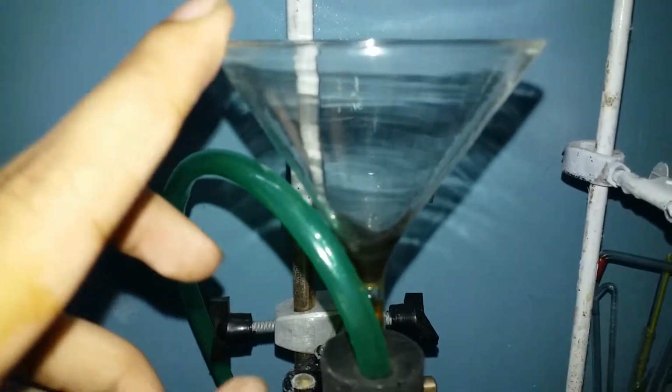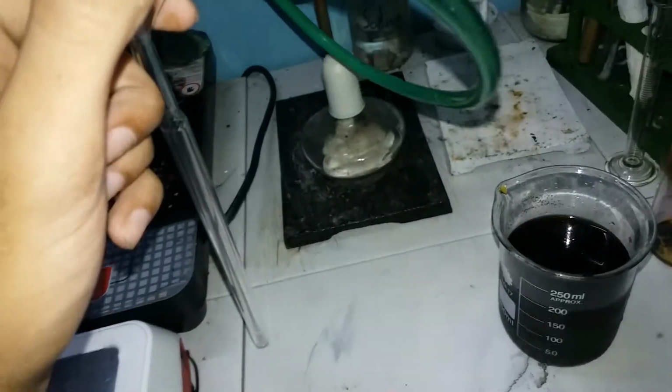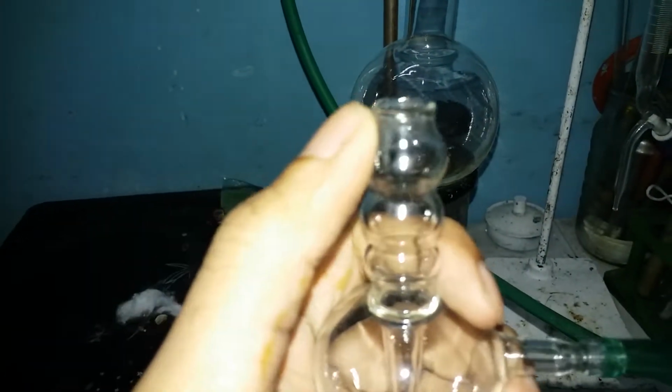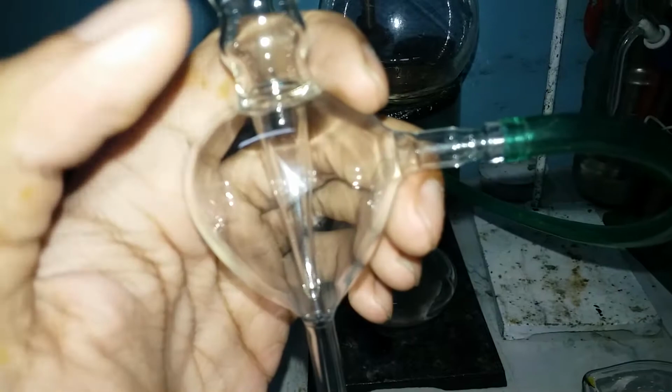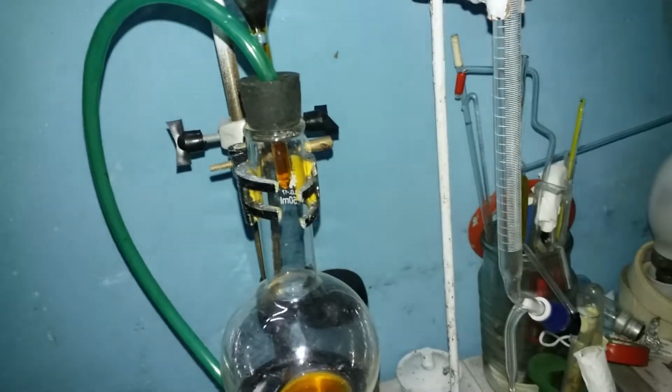So this is my setup. Okay, a round bottom flask with a cork, and the cork is attached to a filter funnel, and then this hosing is attached to this aspirator. Now I don't have a vacuum machine or whatever you call it, because you can't get it in here. So what happens is air goes in there, passes to there, and this creates a vacuum over here. Then this just sucks out air from this through this pipe to this. Simple. So we're just gonna vacuum filter it, and then I'm gonna be back when it's done.